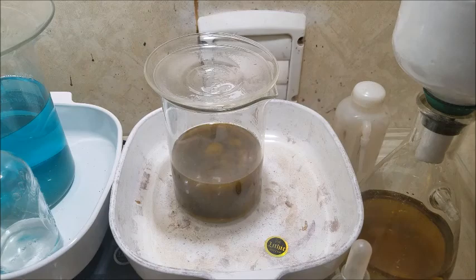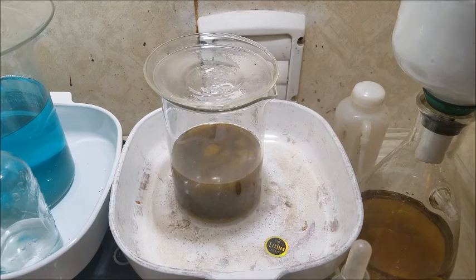Well, it's been quite a few hours, and our solution, I believe, has dissolved all of the gold foils that were in there. I haven't seen any floating up recently, so I'm turning the heat down. I turned it down to medium heat now. I just turned it off, so I've been letting it cool down.